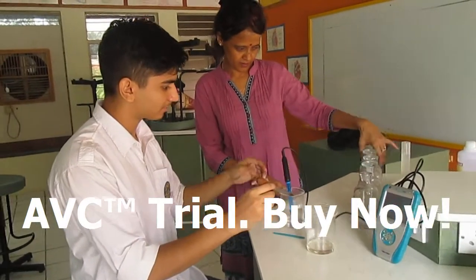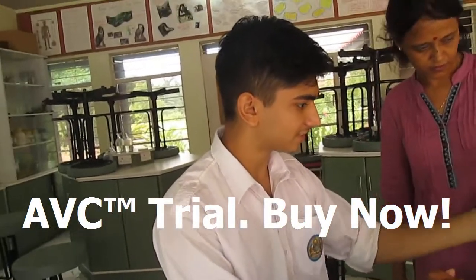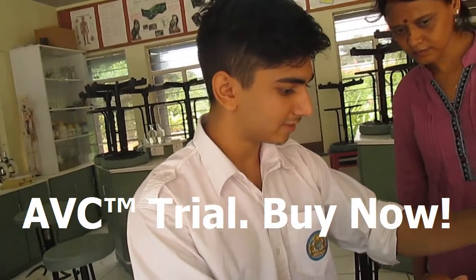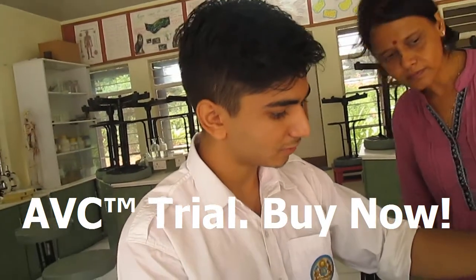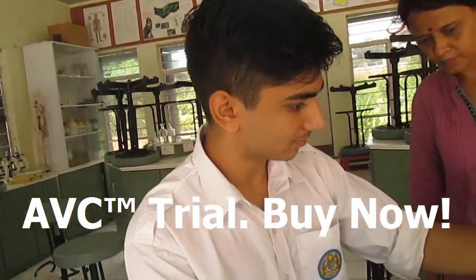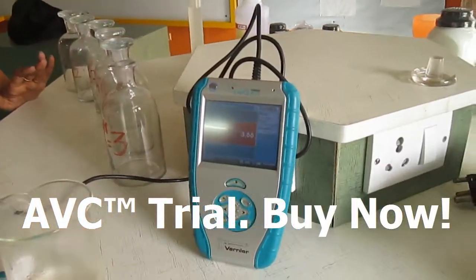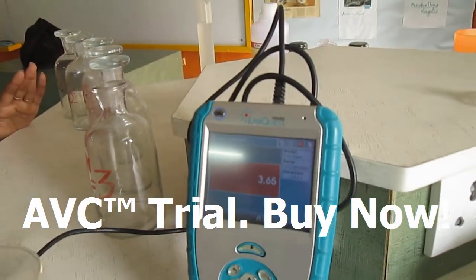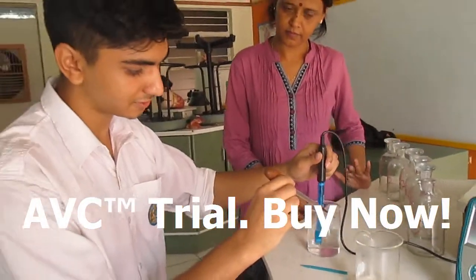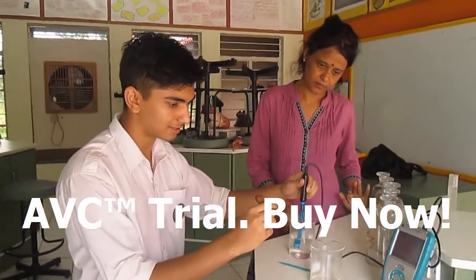I'm making a different pH scale. It varies from 3 to 7. I did this by adding hydrochloric acid into water and then stirring the water to check the pH scale by the pH probe. This is very helpful because it gives accurate results and it is very fast to determine before adding much acid and making the pH level unbalanced.